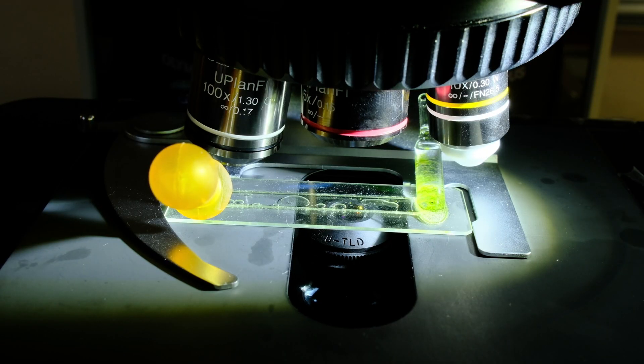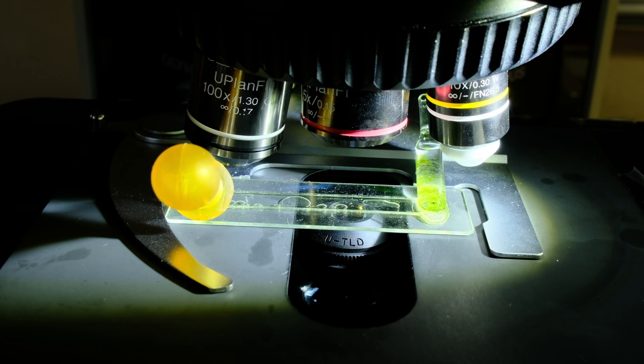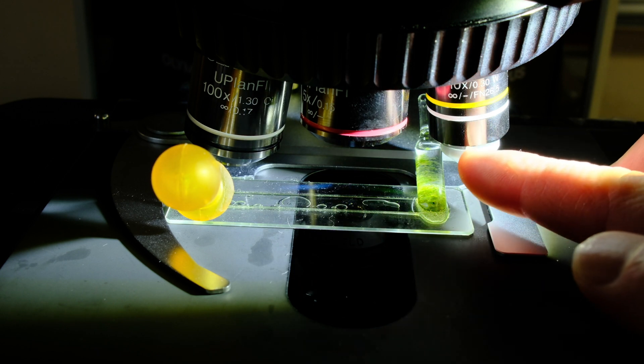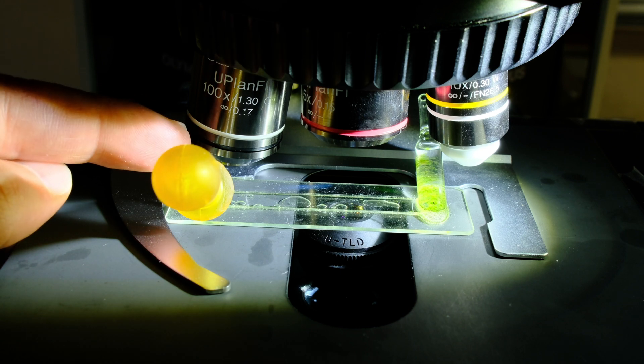Then, when you use it under a microscope, it's not easy to handle. The neighboring objectives, or lenses, get in the way if they are bigger. It might be a good idea to remove them altogether from the revolver, or to space them out nicely.